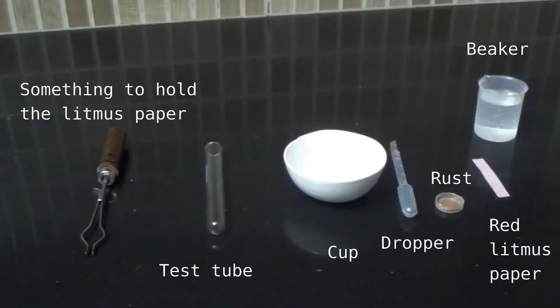Materials required: something to hold the litmus paper, test tube, cup, dropper, rust, red litmus paper and a beaker filled with water.